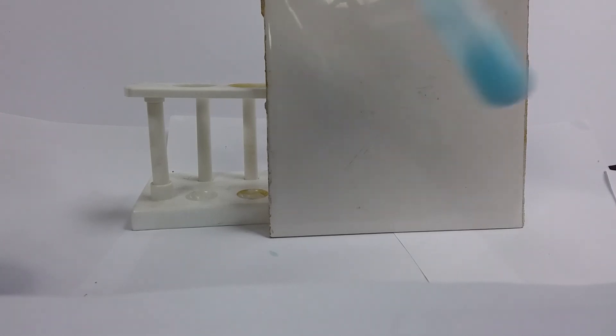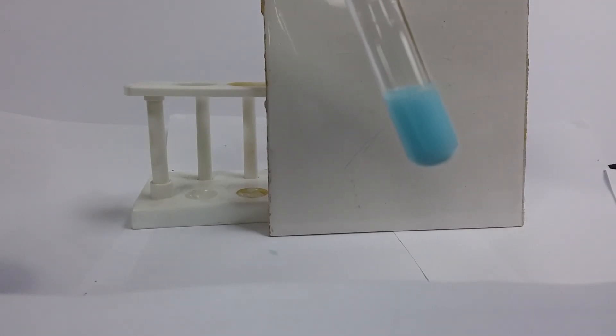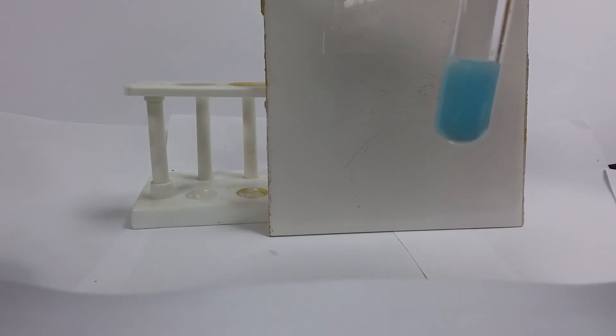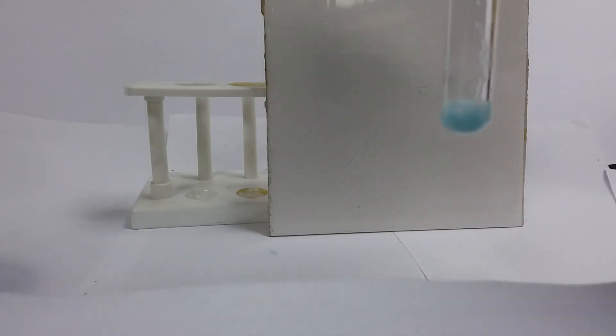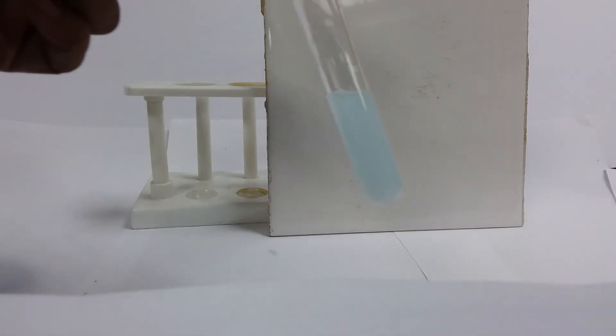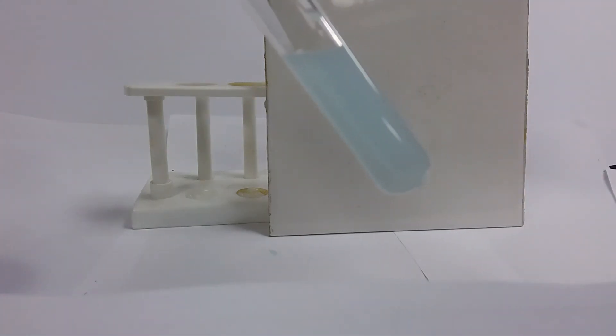Don't say this is a pale blue precipitate — barium does not react with anything to form a pale blue precipitate. We're adding some nitric acid to what we now see as a white precipitate. If we add some nitric acid, let me pour some of this off. Has anything happened to my precipitate? Did my precipitate dissolve? No, it did not. And because my precipitate did not dissolve, I will record that the precipitate did not dissolve when the acid was added.